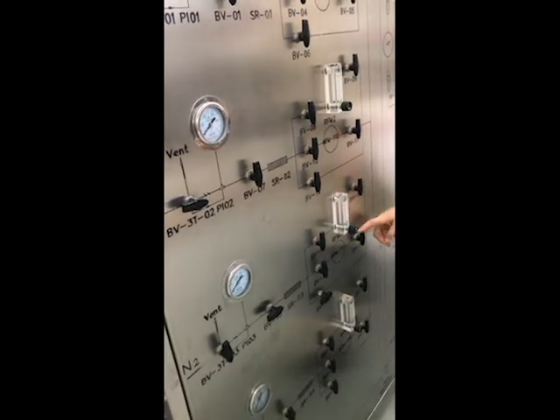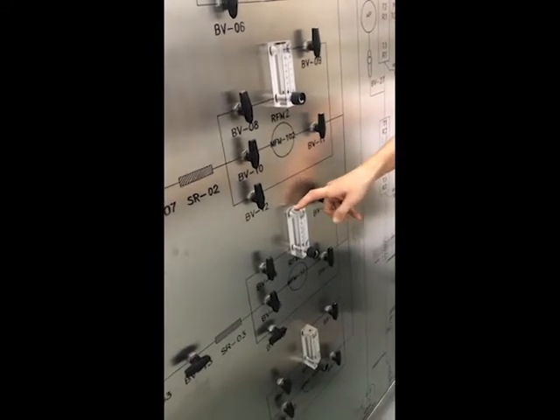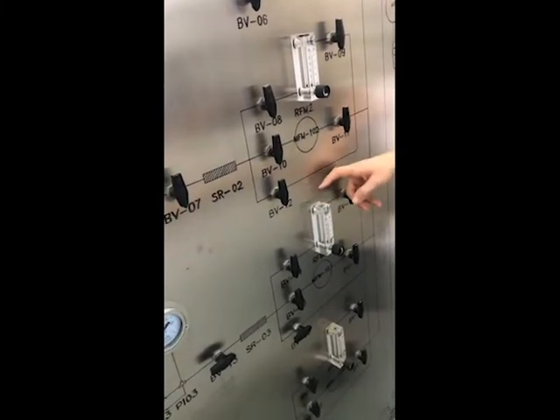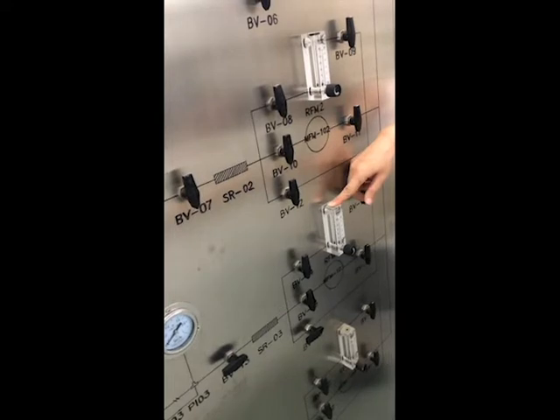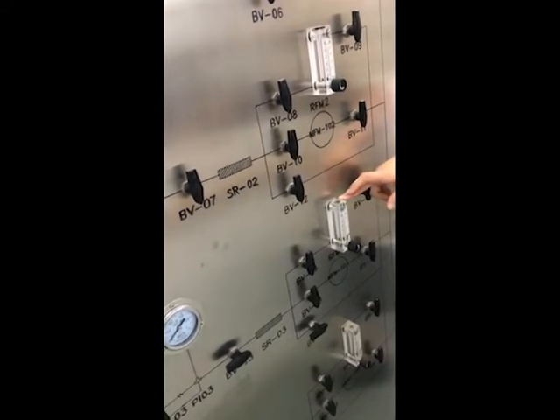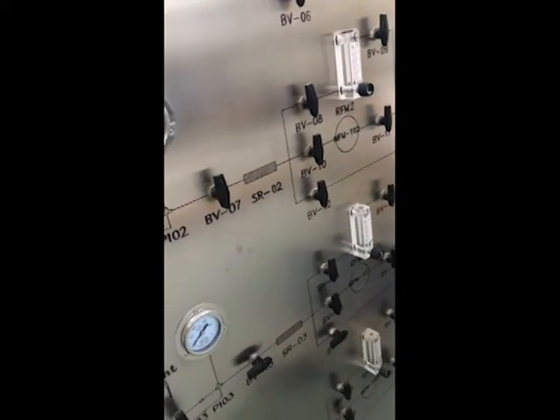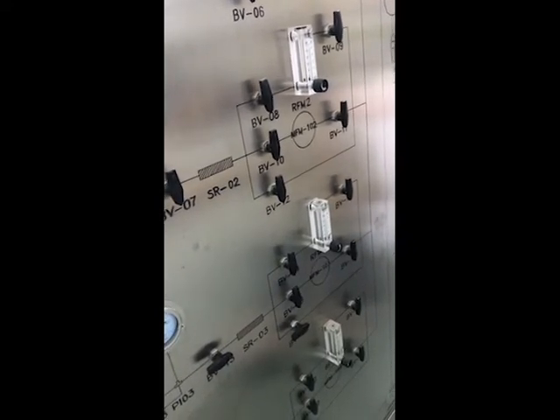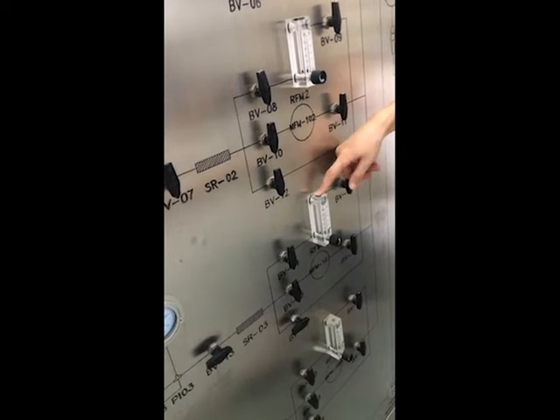Then the other 2 lines: one is for the mass flow controller, used for small amounts, small flow. And when you go into pilot size and need a bigger flow, you can use this one. But when you use the flow meter, you cannot conduct too high a pressure. Maximum pressure is 0.25, otherwise it cannot afford it. Because based on the optimization of your first stage investigation, normally your reaction is conducted under 0.1 megapascal, right? You are not using high pressure. Your target is to conduct the reaction under lower pressure. So when you optimize into pilot scale, you can still use this one.